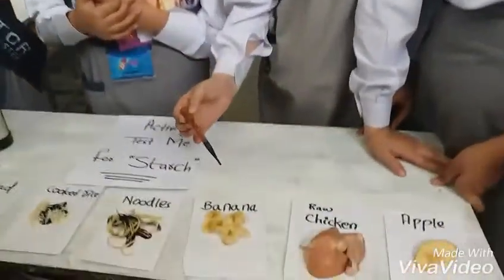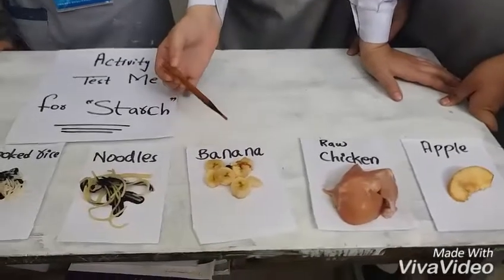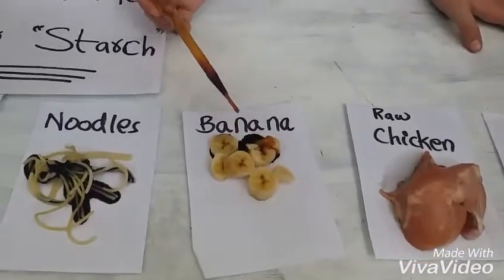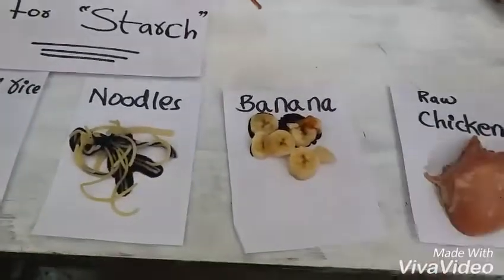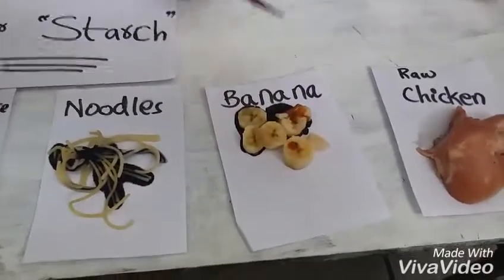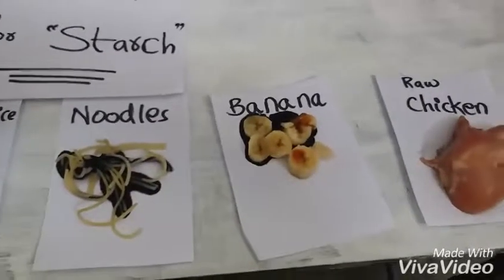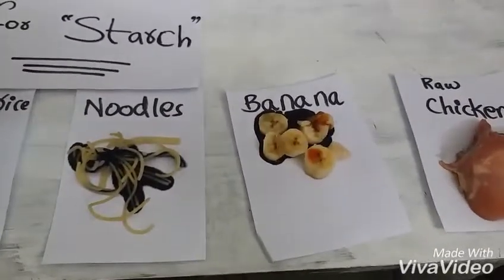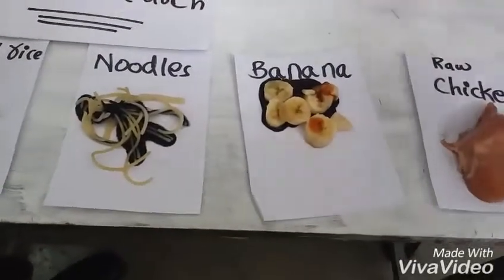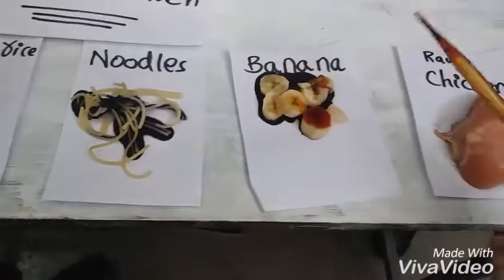Okay, now Kushi. What is the color of the banana? Put it on this banana — a slice of banana. Is it done? No, ma'am. It's not turned into dark blue — it's still brown in color? Yes. Okay. That means there is no starch in this. We will observe this also after a few minutes.